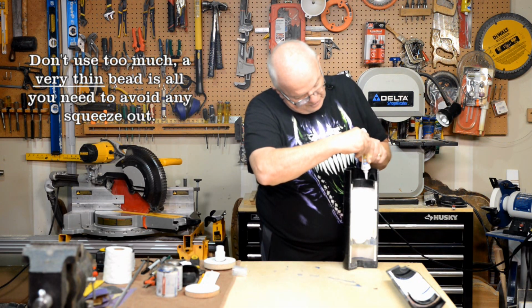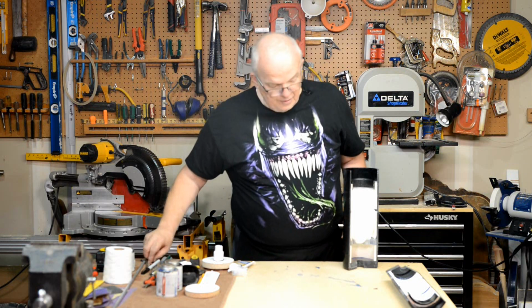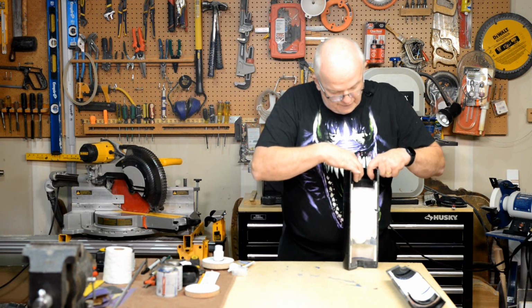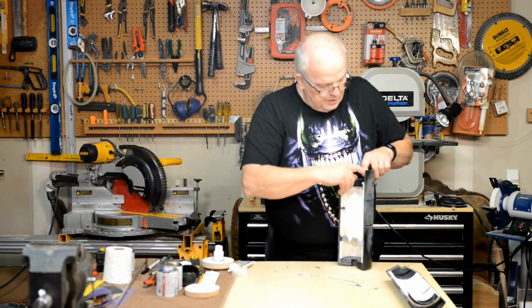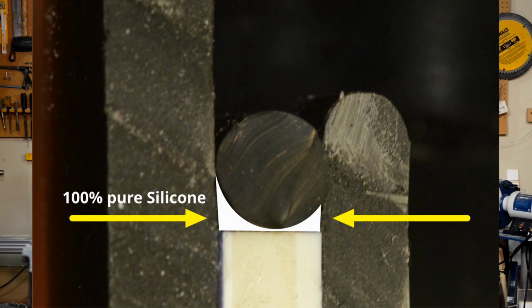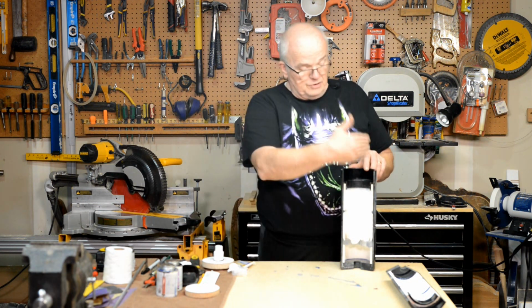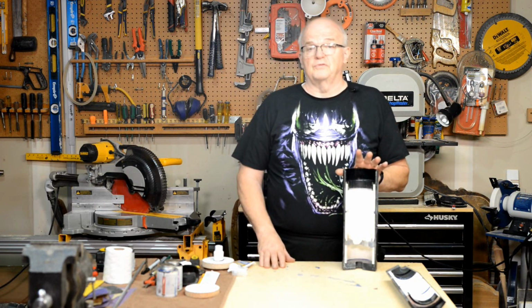Now, you don't want to fill the channel up, okay? I'm not going to do that all the way around. But with that bead in there, when you take your O-ring, and this is just a section of O-ring, and you push it down in there, you can see here in this close-up picture where that silicone now has formed a tight seal that will prevent any air from going down and up the other side. After I did that, I would recommend letting it sit for 48 hours.